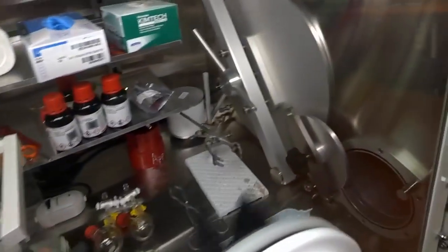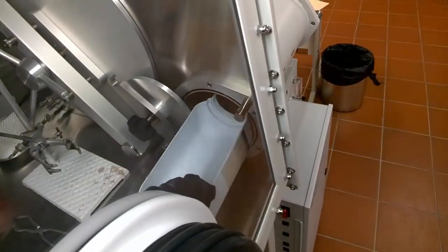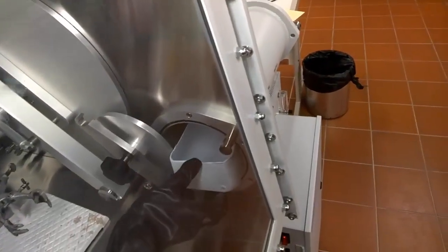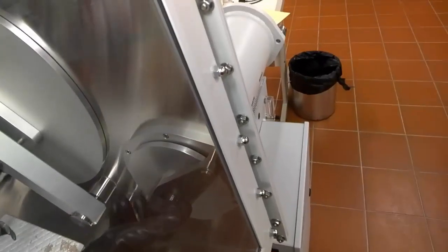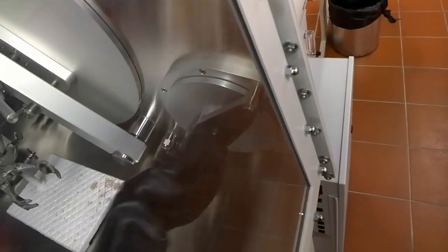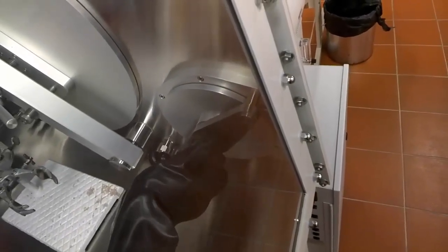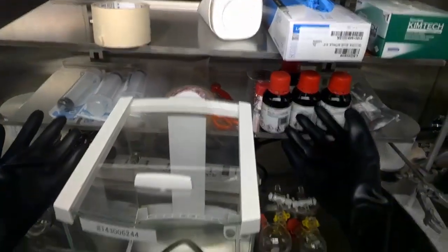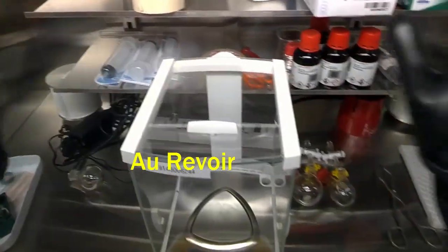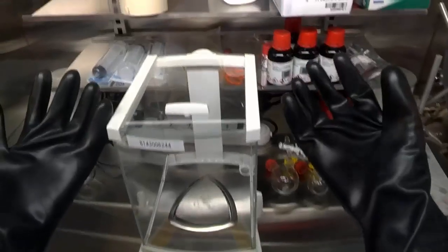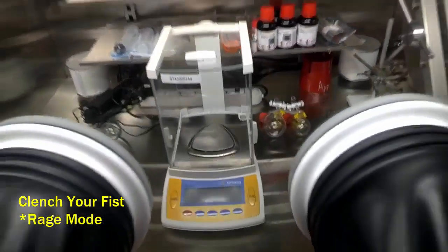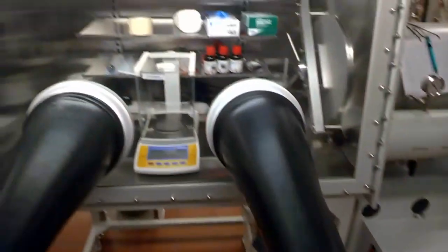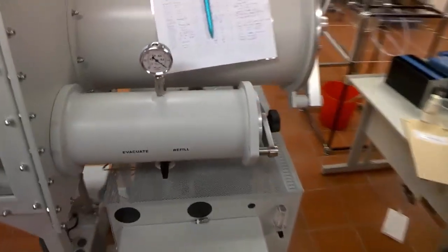Alright. After you are done. This tray. Make sure it goes into the antechamber. And then now close the door. Screw tight. Just finger tight will do. And now. Okay. How do you remove your hands from the box gloves? Alright. Before that weigh first. Alright. So. When you remove your hands from the glove box, clench or fist a bit first. So it is easier for the next user. And then once ready, go for it and pull it out. And ta-da. Look at that. My hands. Resume freedom.